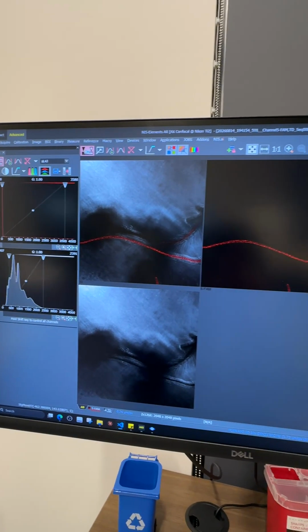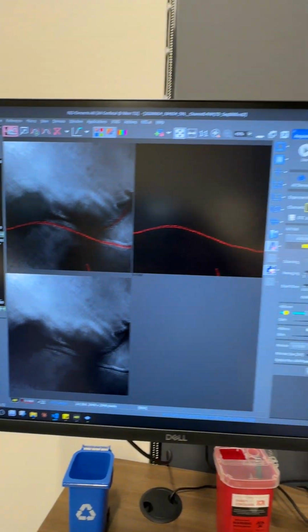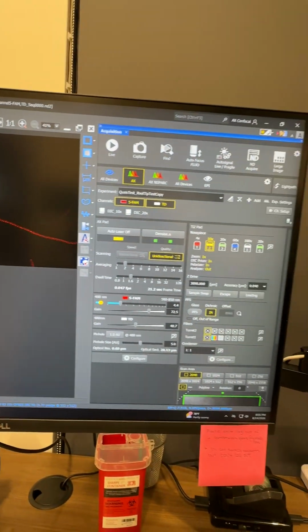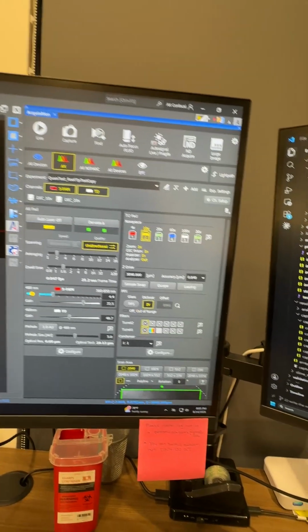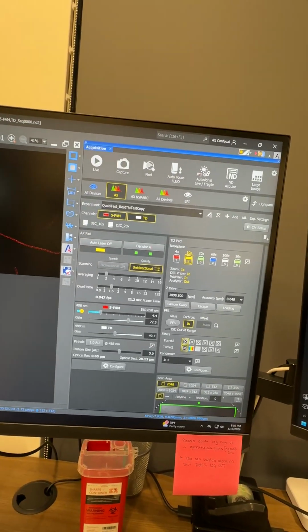So that's it. This is the script which is capturing the real images, doing the calibration of the images, and actually moving the real microscope stage. And we have confirmed it against the real hardware.